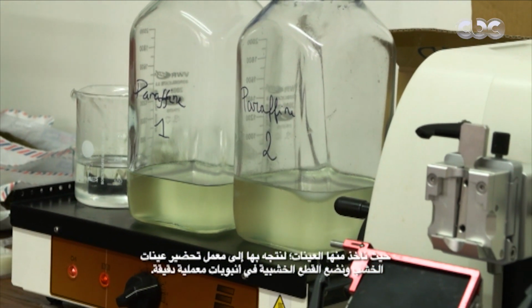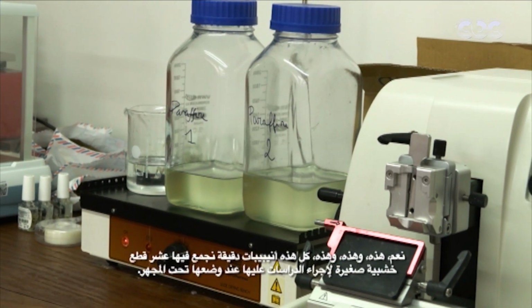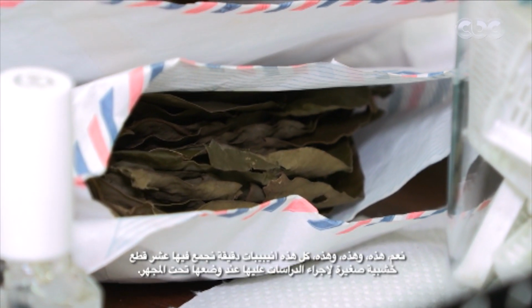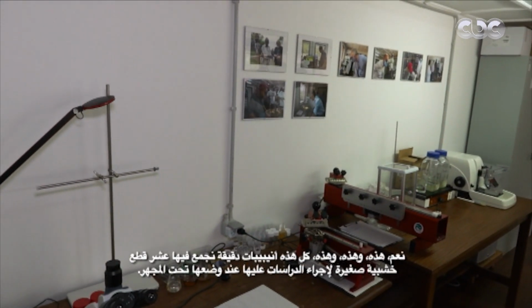So we take small blocks of wood, and then we put them on the microtomes. Different kinds of microtomes, to make very thin sections of the wood, microscopic thin sections, so that we can study those under the microscope.